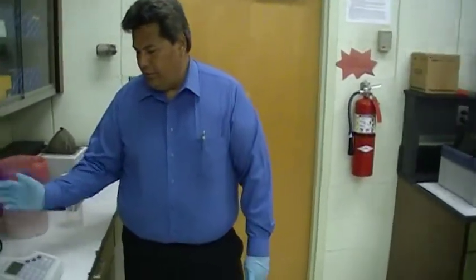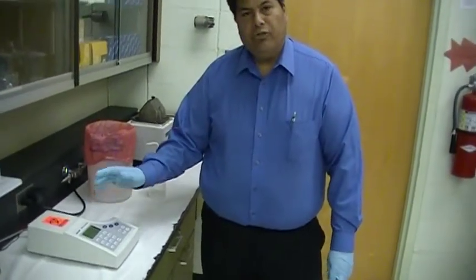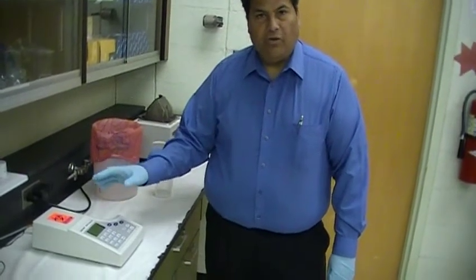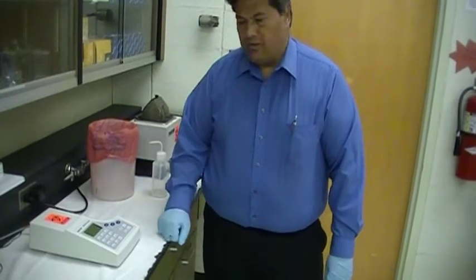Alright, this is how they use the biophotometer, this is a spectrophotometer. Now this machine can be used to measure ultraviolet range for DNA and RNA concentration or visible range for protein concentration.